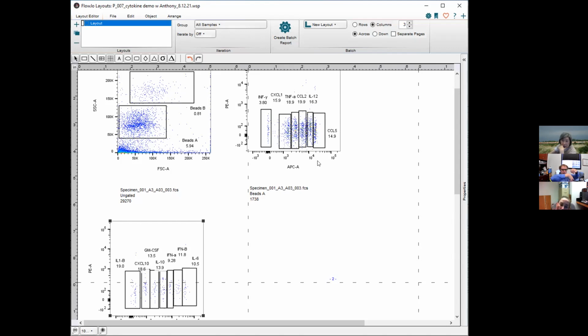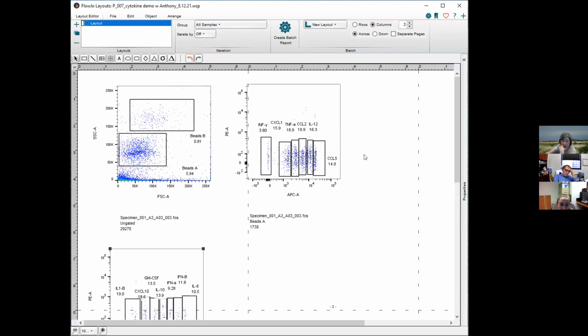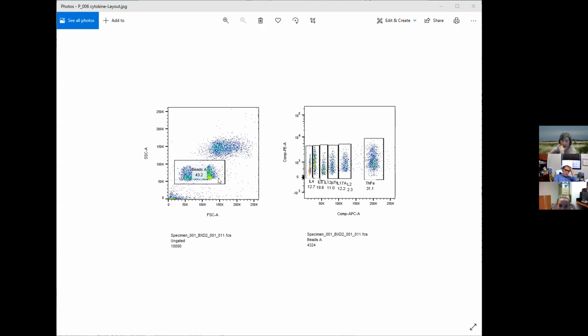I see. I don't know though. I thought he didn't say that there was anything wrong with the way that looked, because I also adjusted the axes so that we could get some separation. I guess I can ask again if that's an issue of some sort. Last time I got the same type of thing, but look at how many more beads I had.